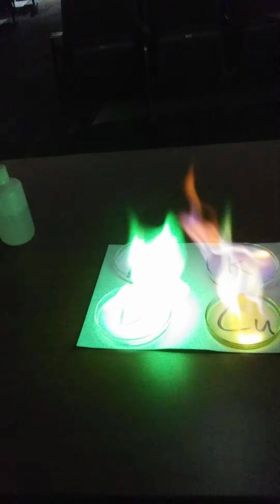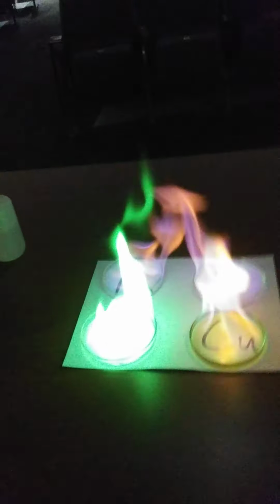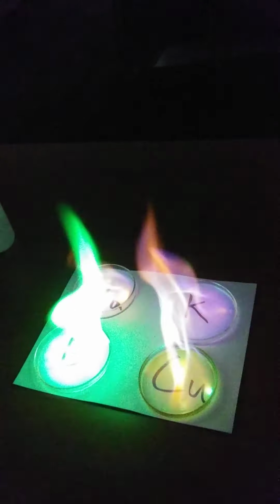So, isn't that cool? Now imagine you were here in class, and the idea here is we're seeing different colors for the different elements. I think right now we're seeing a lot of orange on ones that shouldn't really be orange, like the potassium one. And I don't know if maybe I didn't get the dish as clean as I could. And the boron color is not really showing. I don't know if my phone is, the boron just looks white, doesn't it? It's actually really green. Maybe you can see green tips on it.